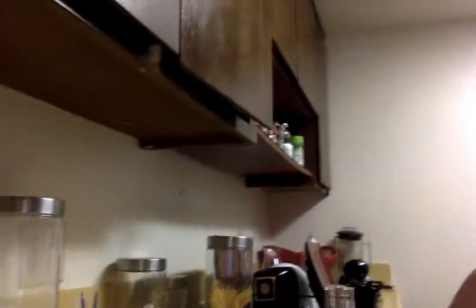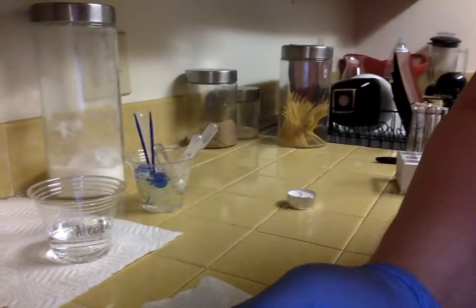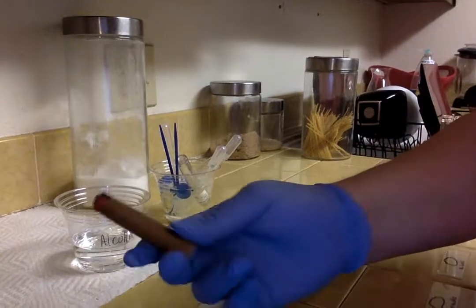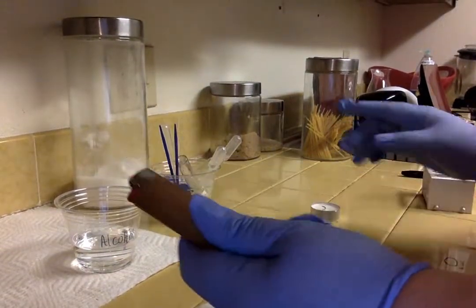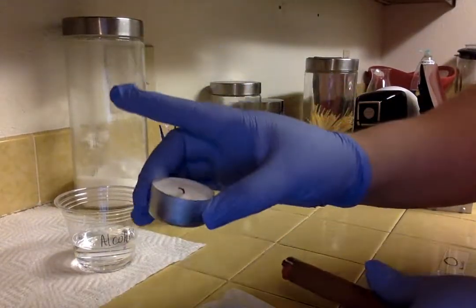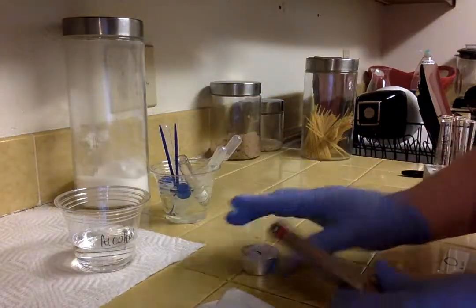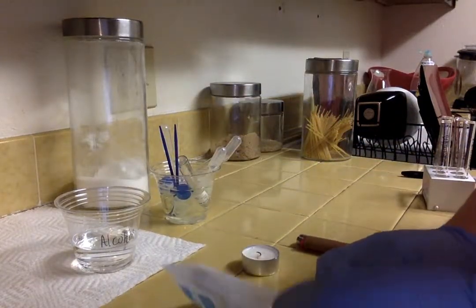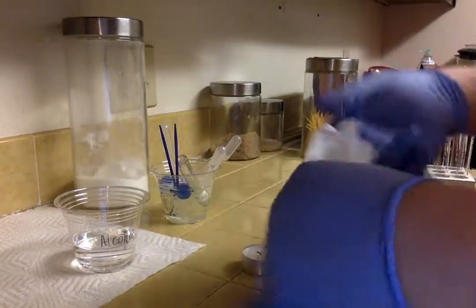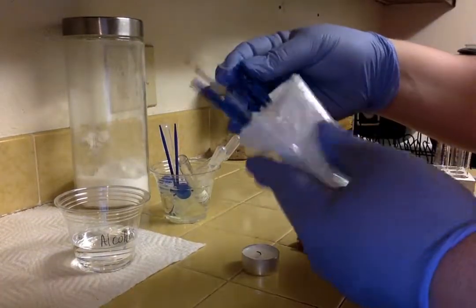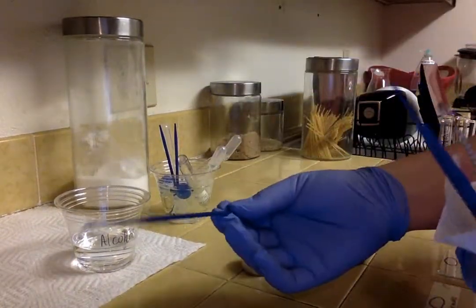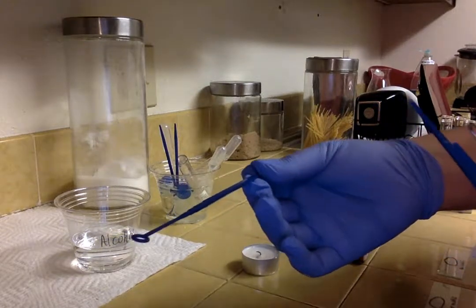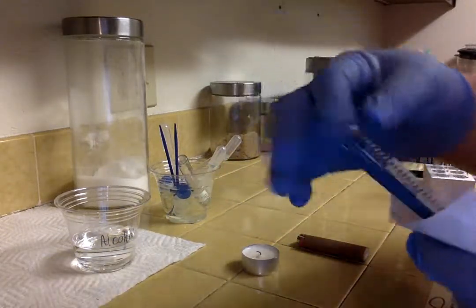So I'm going to show you my area here. I'm going to show you some of the stuff I used today. My lighter and candle to do my sterilization. I'm going to use this to gather the microbes for one of them.